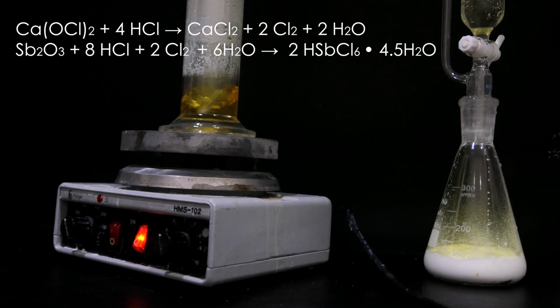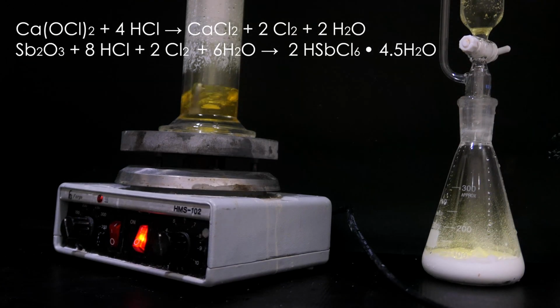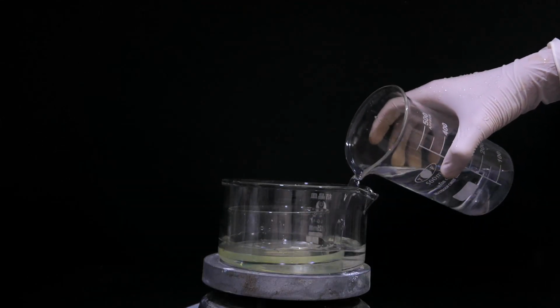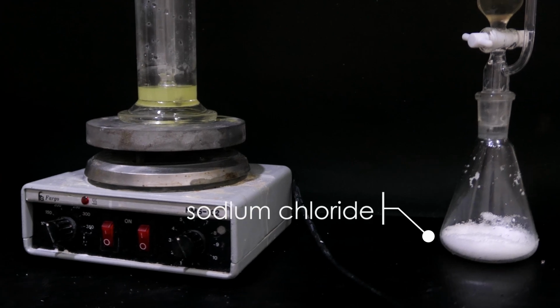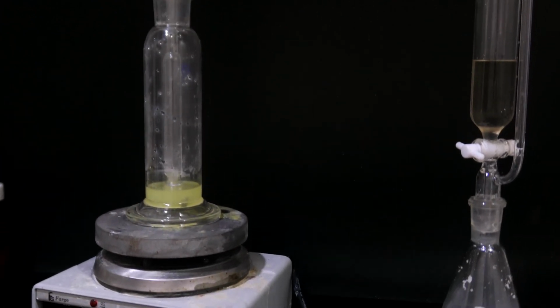As the chlorine passes through the slurry, it oxidizes antimony trioxide to antimony pentachloride. Then, it is reacted with hydrochloric acid to form chloroantimonic acid. Once all the trioxide disappears, the chlorine generator is turned off. After that, the solution is concentrated somewhat on a hot plate to remove excess water. The solution is again poured into the bubbler. This time, gaseous hydrogen chloride is bubbled through.